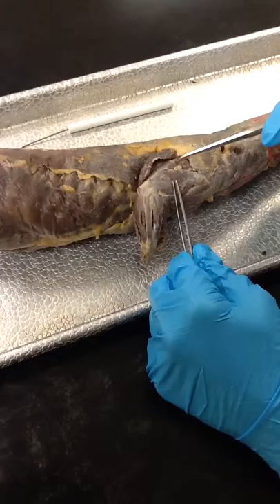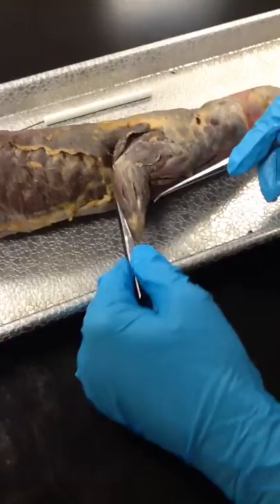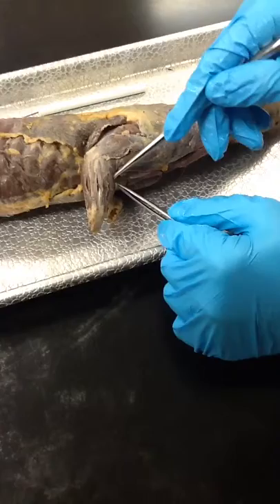Now we move on to the arms. On the arms we have the dorsal epitrochlearis, the triceps long head, triceps lateral head, and then brachialis. Right here is the brachioradialis.